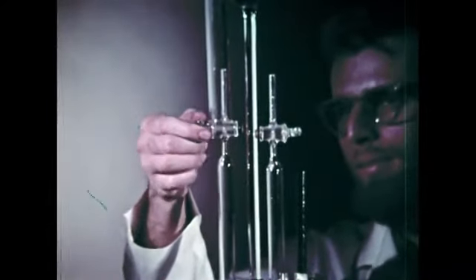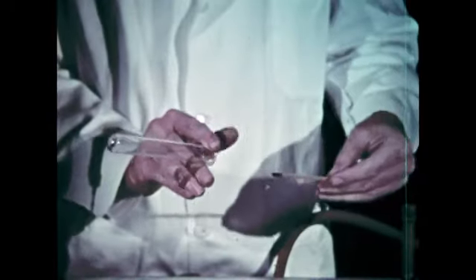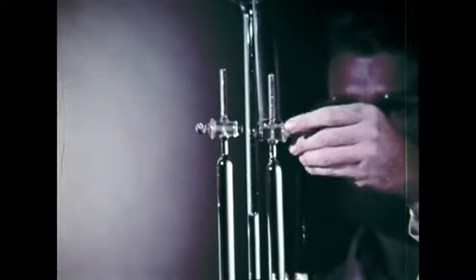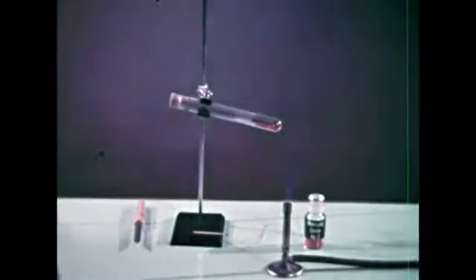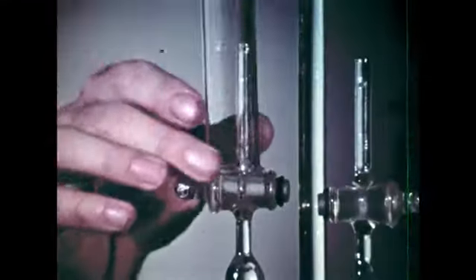We have enough gas, so we'll test its identity, first from the positive pole. It fulfills the old-fashioned criterion of oxygen. Next, the gas from the negative pole, which acts like and is hydrogen. So in these seven experiments, you have seen the ubiquitous oxygen produced and some of its properties demonstrated.